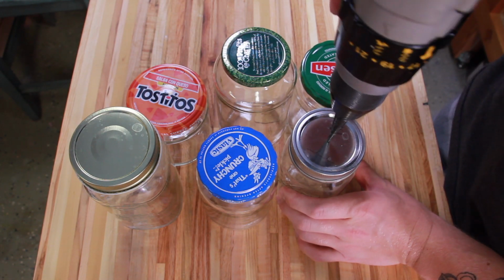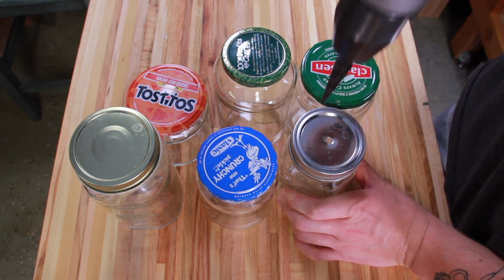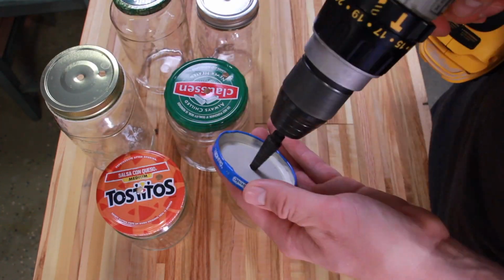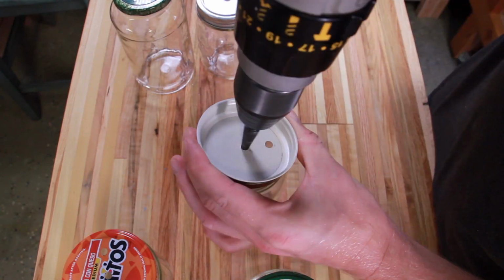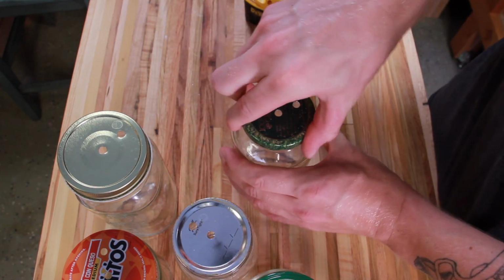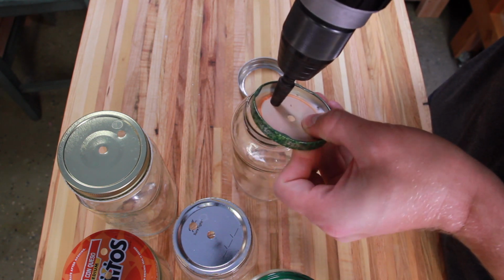I started by drilling 2 holes in each of the jar lids. One hole is for an injection port and the other hole is for a breathe port. Then flip each lid over to deburr the bottom side, and I'm using a step drill bit here, which I find to be the most effective way to drill holes in lids for grain spawn.